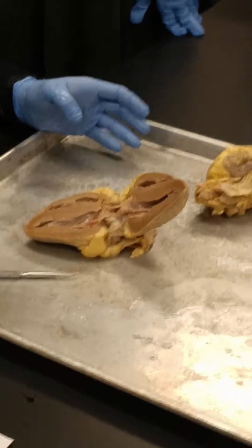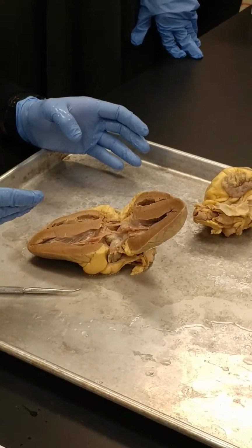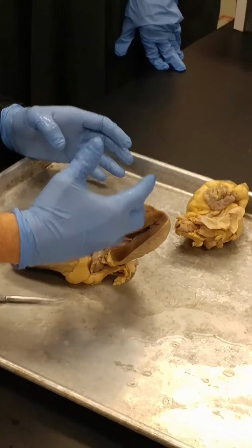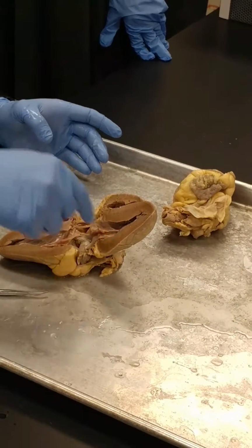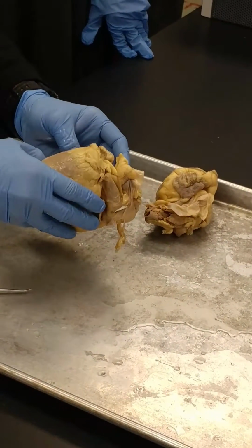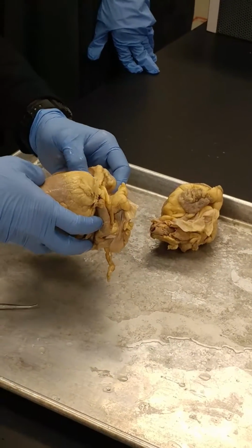Agreed? Mm-hmm. So the coronary arteries, you've heard of someone having a coronary or coronary bypass surgery. Those are the arteries that go to the heart muscle tissue. The cardiac veins are the veins that take the blood that's been to the heart and then send it back to the heart again. Okay? So the cardiac veins, they all collect back in this thing called a coronary sinus at the right atrium.